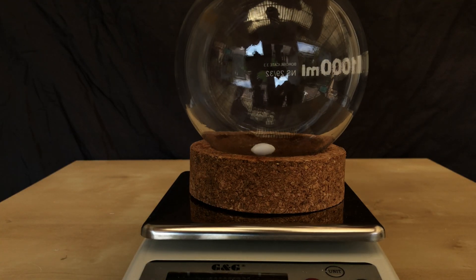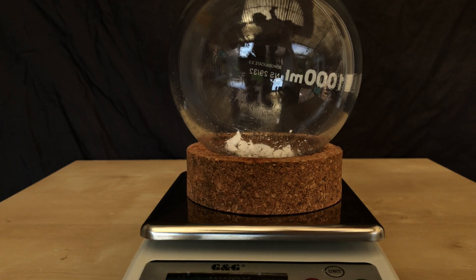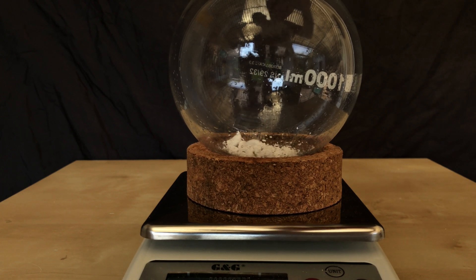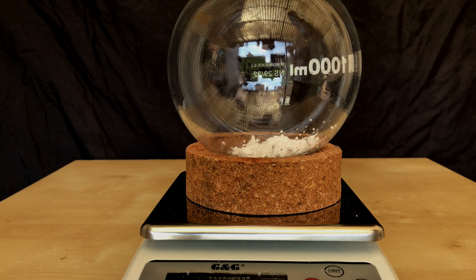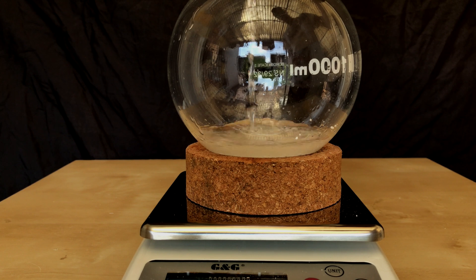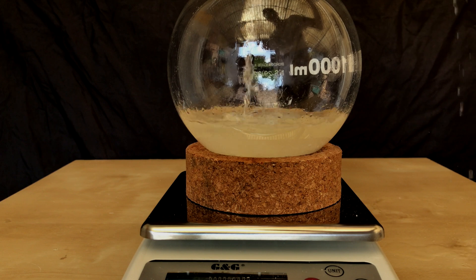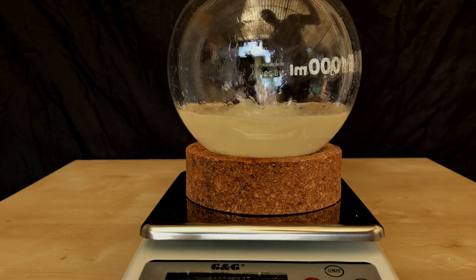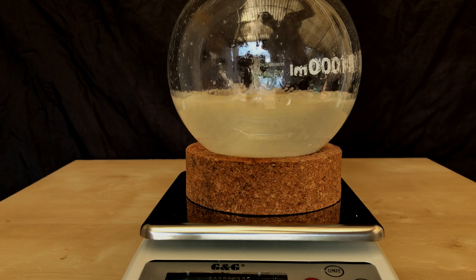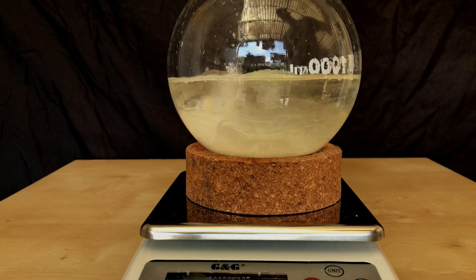Let's begin by weighing out the potassium cyanide. I work carefully while doing this because I don't want to poison myself, and I added about 10 grams of potassium cyanide directly to this round bottom flask. The scale was set to zero and we added 100 grams of freshly opened benzaldehyde. To make everything dissolve, a mixture of water and 96% ethanol is being used — 200 grams of each.